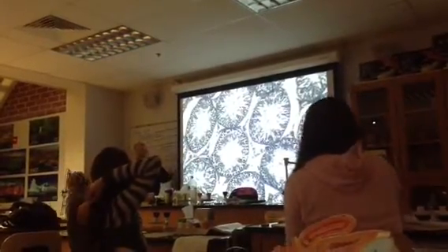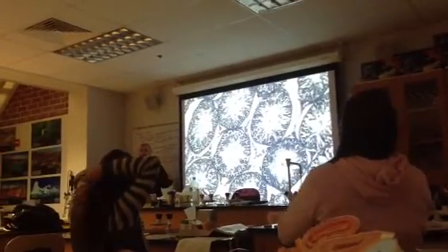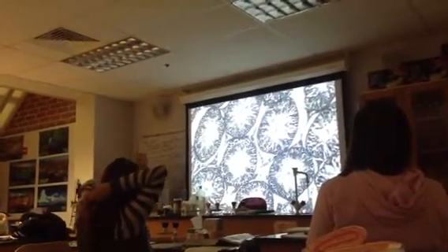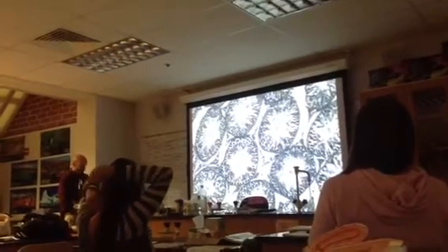If you look at any of the textbook or lab book drawings of the testes and seminiferous tubules, they look exactly like the slides. So very seldom do you see something that looks just like it does in the textbooks and various pictures. But that's all there is to that. We'll go into more details on meiosis in the lecture.